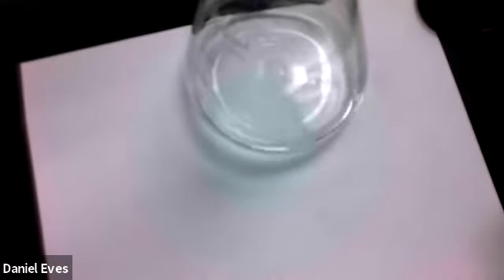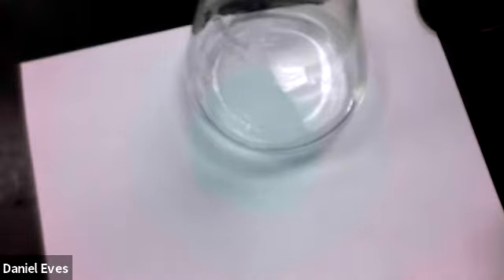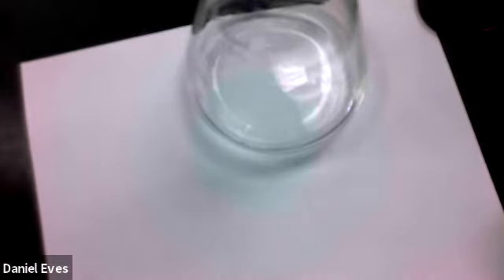So this is a weak acid, but that shouldn't matter to us because the number of moles of acid should be the same. So I put the phenolphthalein in, and the starting part of this burette, we're at 0.1, which is a common theme so far.